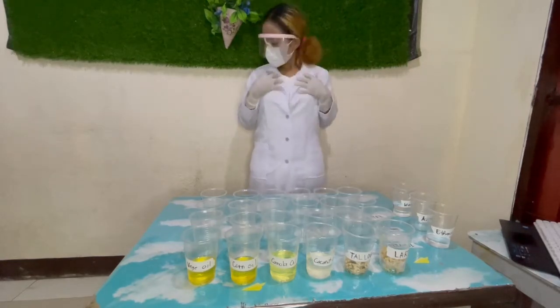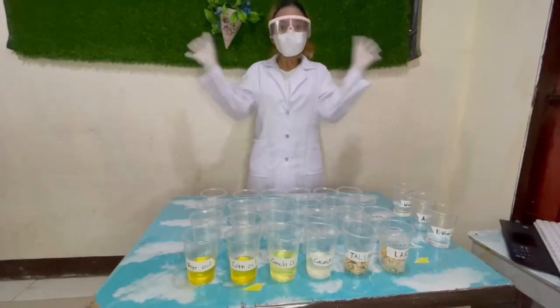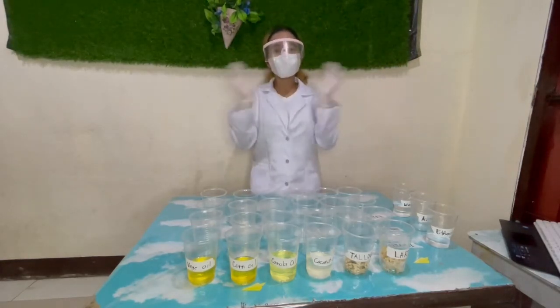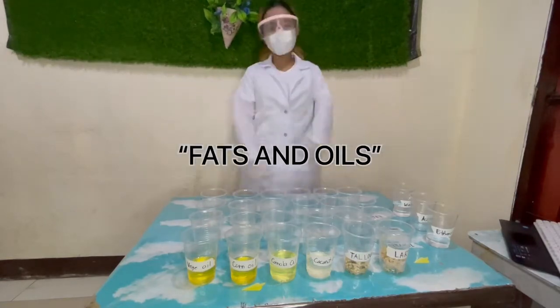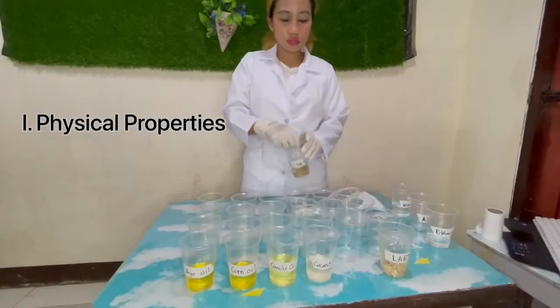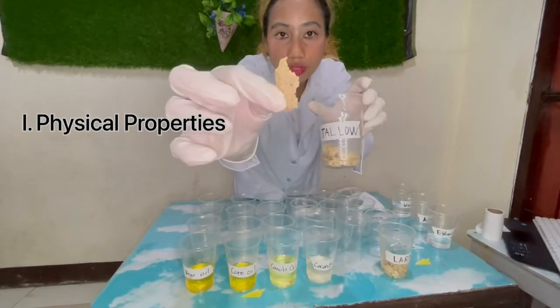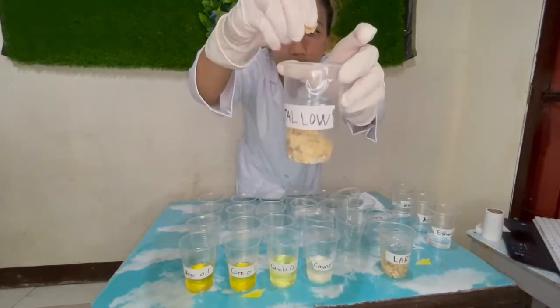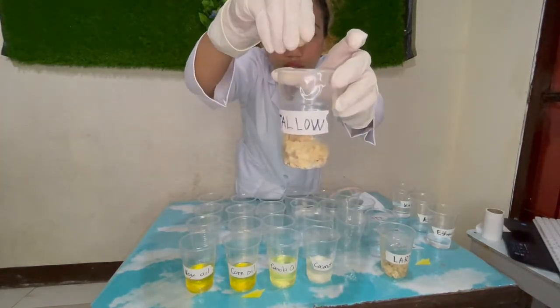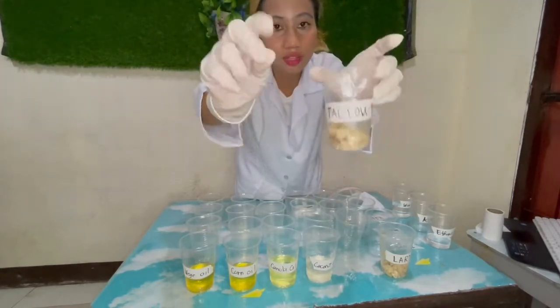So I'm a BS Bio student in 1st year and my name is Ayla, and today we're going to experiment about fats and oils. So let's start! In our first part, we don't use our safety goggles and face masks in order to see the physical properties and smell the odor.